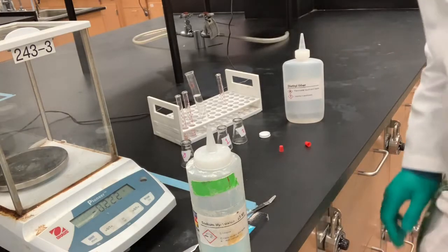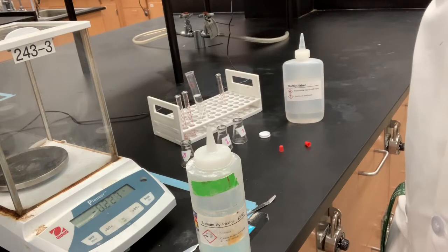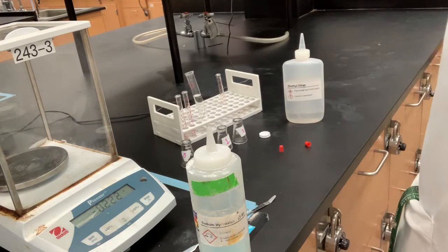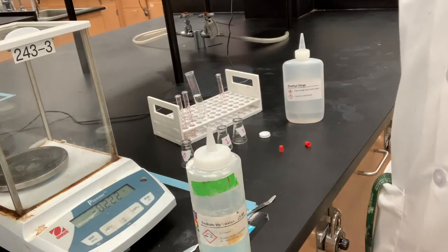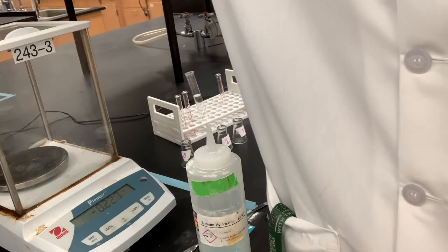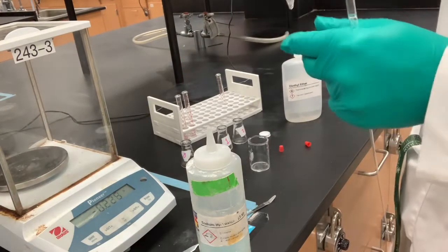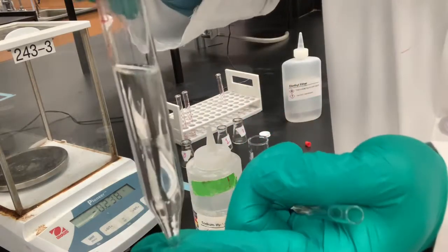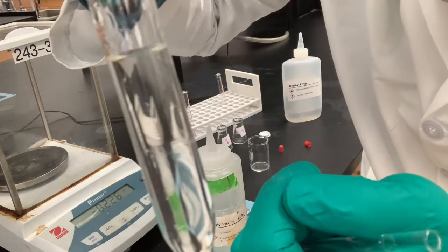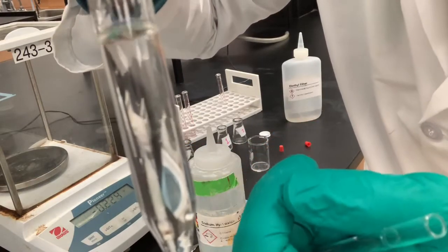And we'll move on to the next step, which is step number 6. Again, you should be able to tell at this point which layer is which, and that should be included into your report. So now if we take a closer look at this, we can see that there are 2 distinct layers, with the separation being right here.